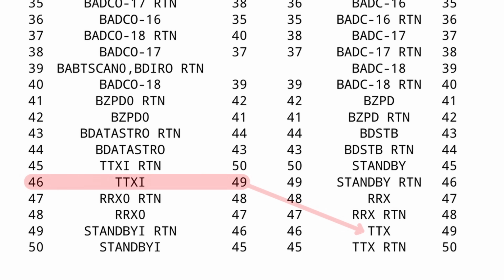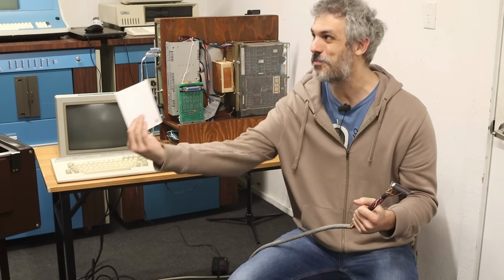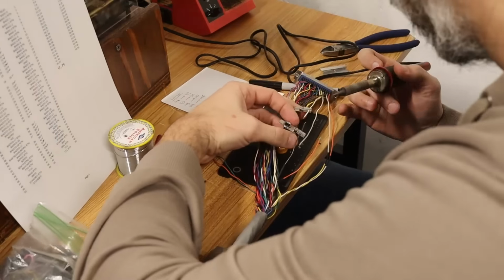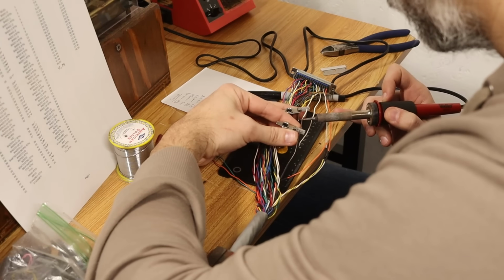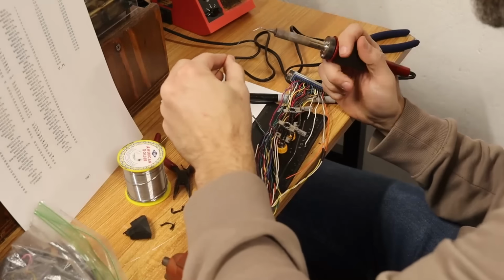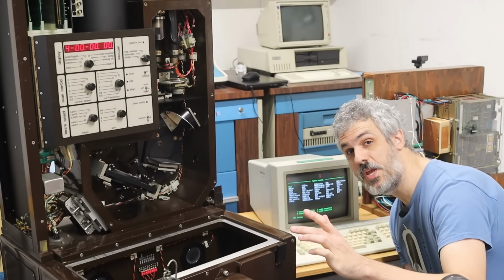In my notes, I saw that I connected up pin 46 to pin 49, pin 45 to pin 50. This should be our transmit going into the Bomem. And looking at the schematic, that is wrong. We have the transmit coming from the Bomem and the transmit coming from the PDP-11 running into each other. So it's just been like a comedy of errors of me just getting RX and TX backwards over and over and over again.